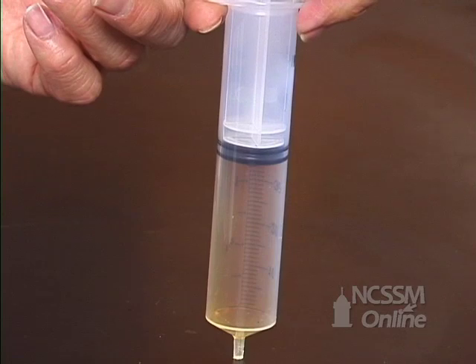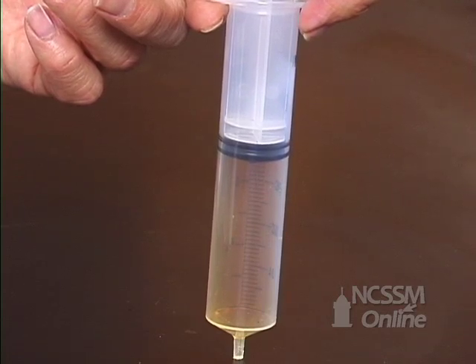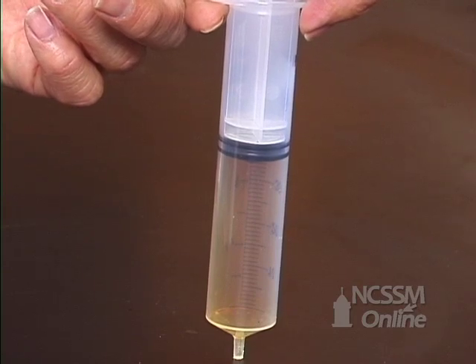However, if we watch the gas for a moment, the color becomes darker as more NO2 gas forms.